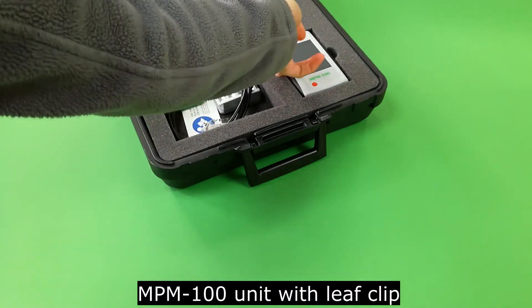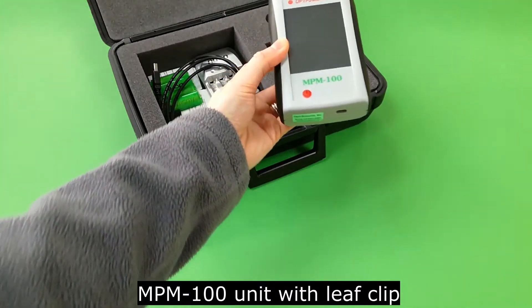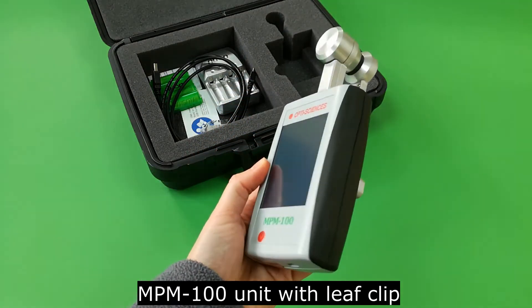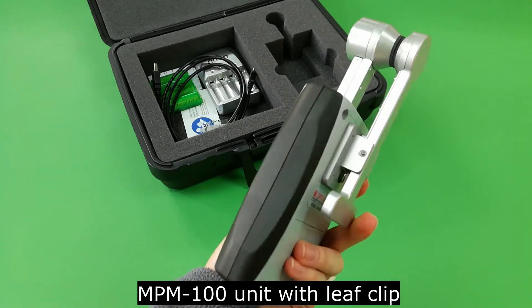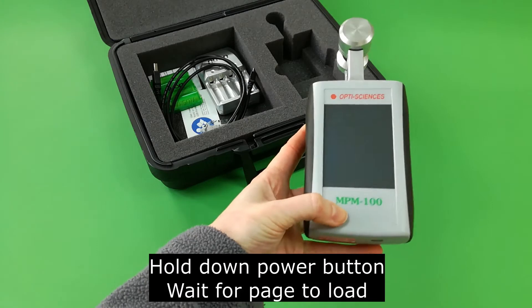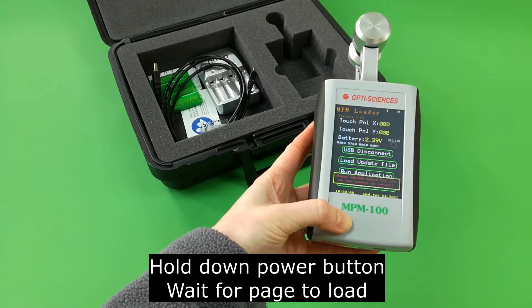Here is the MPM unit with the manual leaf clip. To switch on the MPM, hold down the power button and wait for the home page to load.